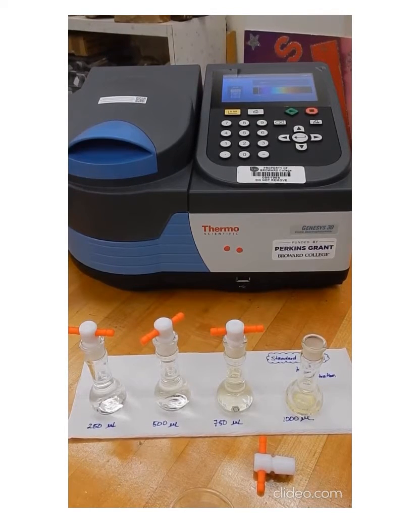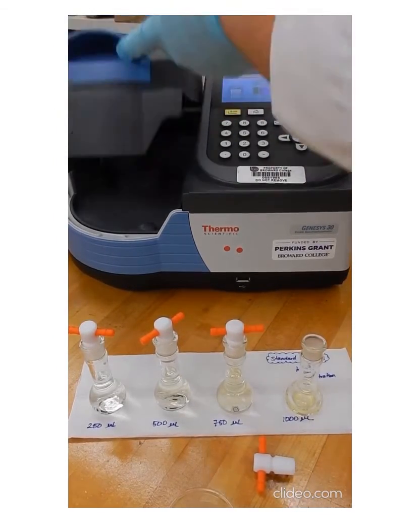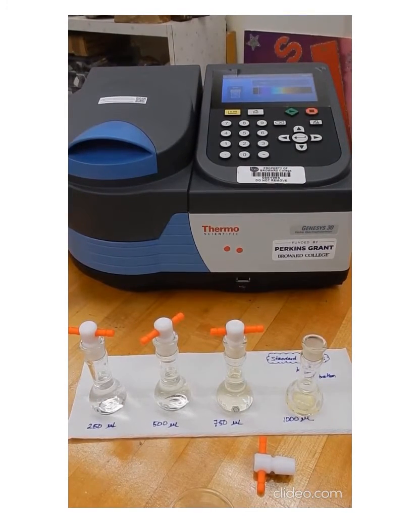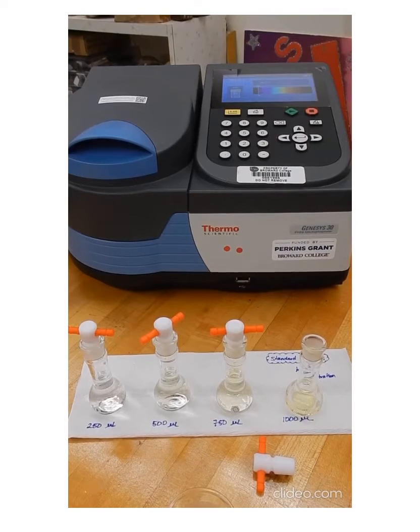for our standards. Since we have 4 standard solutions, we're going to have 4 values of absorbance, one corresponding to each solution. Our solutions, the concentration is increasing because we're adding a larger volume of the potassium chromate in the last standard that we're preparing here. So you have your 4 data points for the absorbance for these 4 standards here, and you're calculating the concentrations for them, and you can prepare the plot.